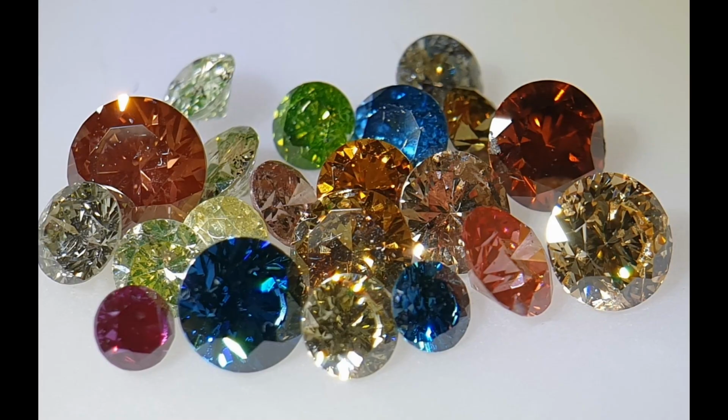After watching all these stones and their reactions, you should start to understand the complexity of dealing with fancy colored diamonds. And by the way, we discussed only two colors, and the ones which require less effort than others. Multi-step treatments and synthetics are the real challenge today. Science allows us to really get an ugly frog and after a number of steps turn it into a beautiful prince. Fluorescence spectroscopy can be very useful, sometimes diagnostic, but in most cases it provides only a piece to solve such a complicated puzzle.